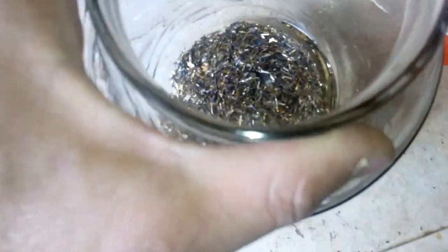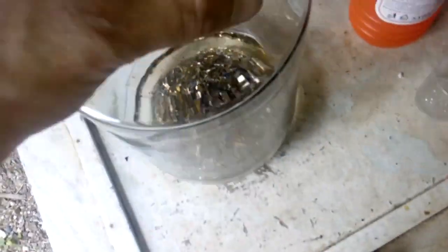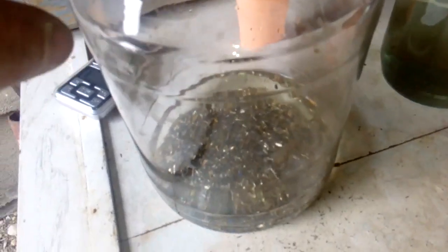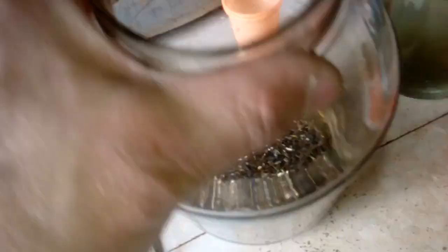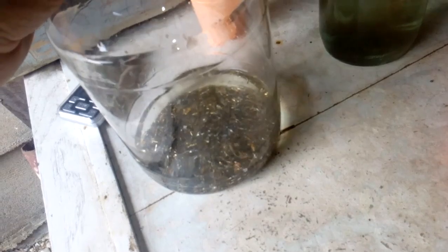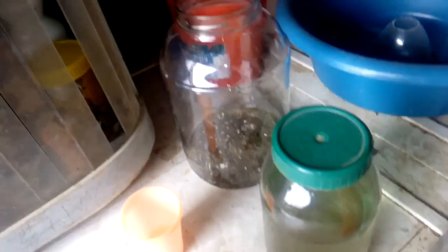When I depopulate I do it on a wooden surface, so maybe I scratched some wood in with the pins. We put this outside on the sun — let's keep it open. I don't use an air bubbler; you can use an air bubbler to speed up the process but I don't use one. We will leave this for now and come back maybe a couple of hours later.